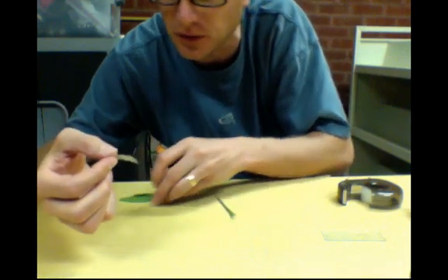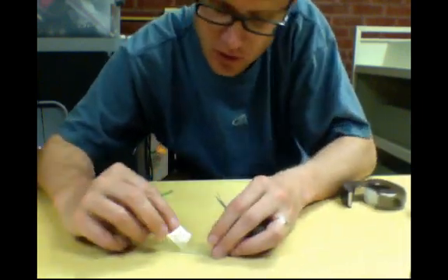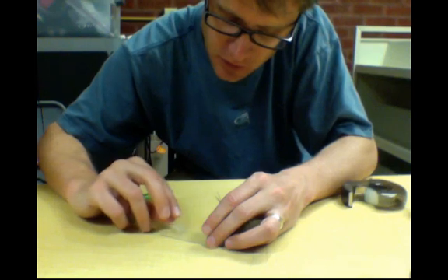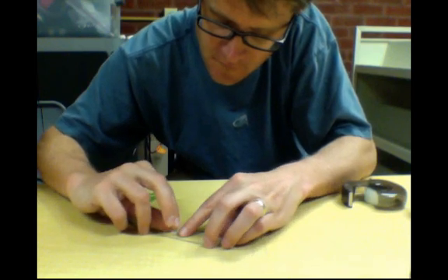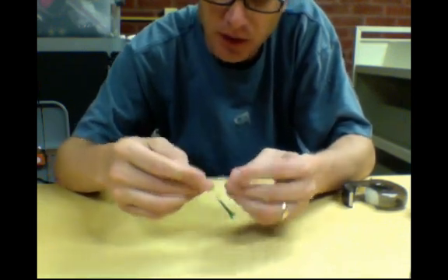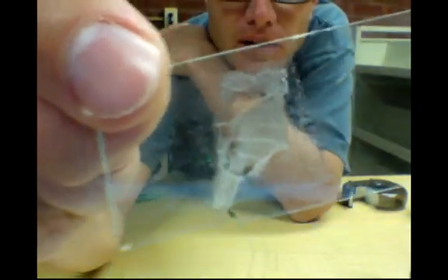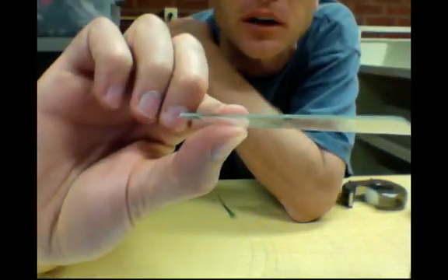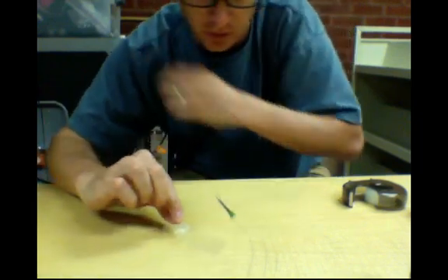And then essentially what you're going to do is peel it off. If you do it really carefully what you'll get is an impression of the leaf. Now I can just simply put that on my microscope slide. What we now have is an impression of just the epidermal cells. We've pulled all the epidermal cells off the top, and hopefully we've pulled off the stomata.